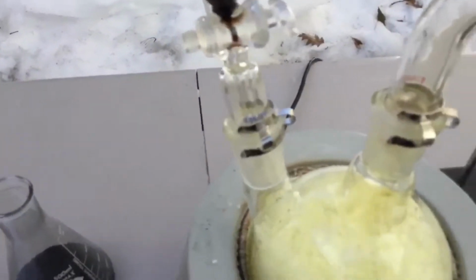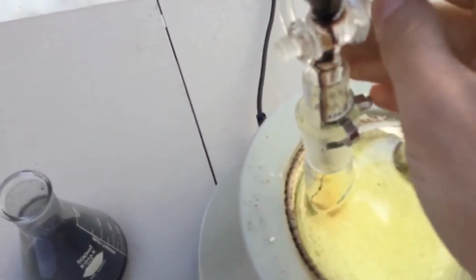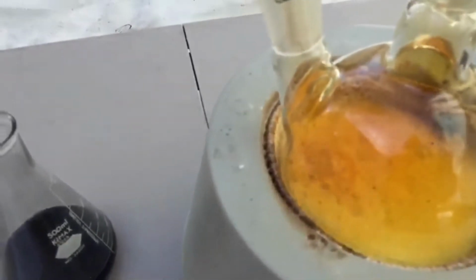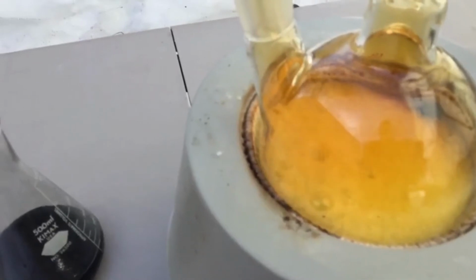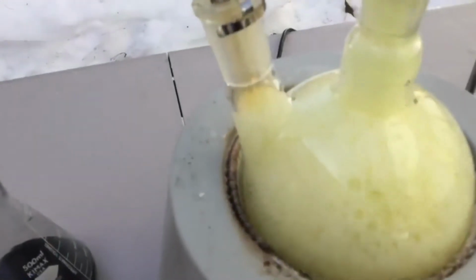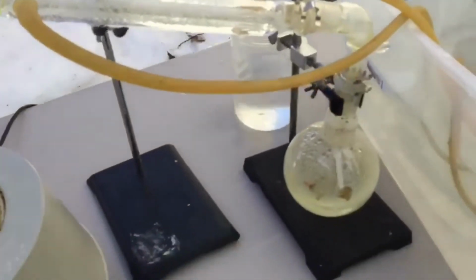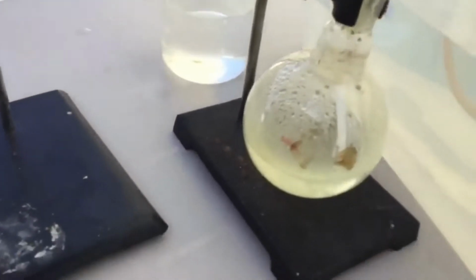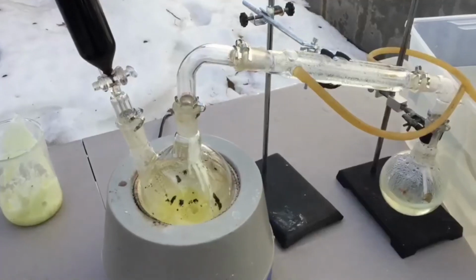I can't add too much sulfuric acid because, here, I'll show you what it does. It makes all this gas, but as soon as it comes back up, you'll see what it does. Oh no, there it goes. See? Poof. All over my setup. So yeah, I'm going to do this in 2 different batches because I don't want to ruin too much of my final product. And I'll see you guys in a bit.